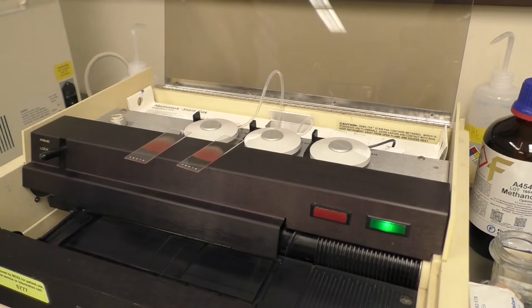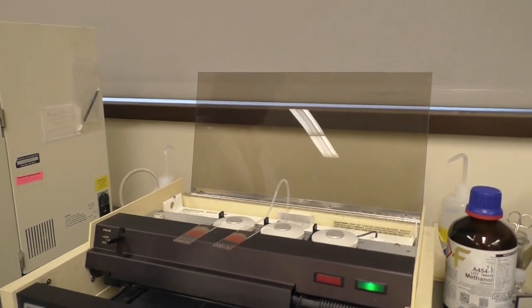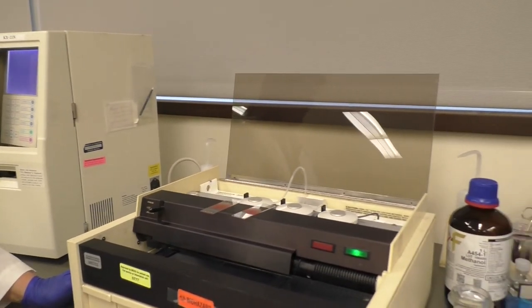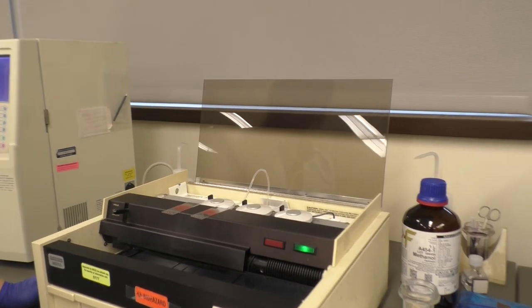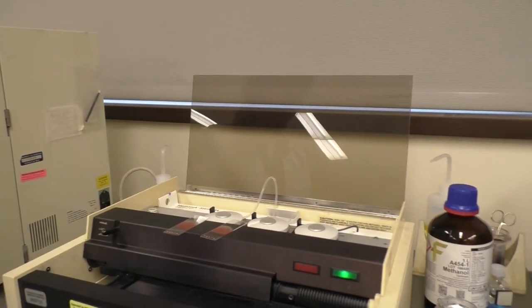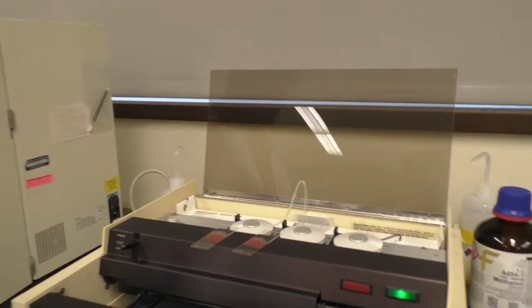Oftentimes, the priming procedure will have already been done by the instructors prior to your arrival in lab. If so, you can begin with the staining smears portion of the procedure.